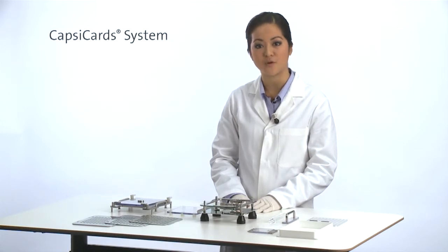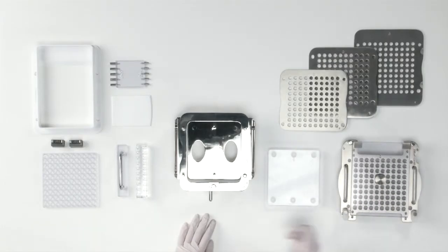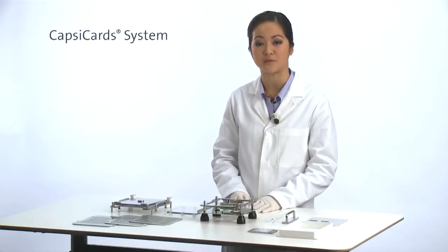A 100 hole machine has 10 rows of 10 capsule holes. A 120 hole machine has 12 rows of 10 capsule holes.